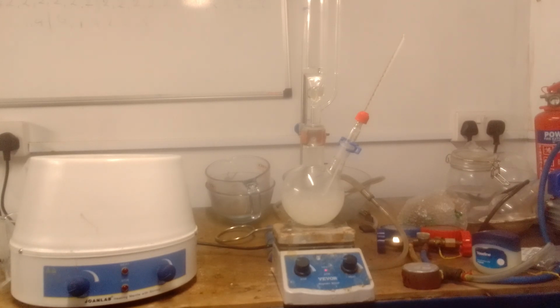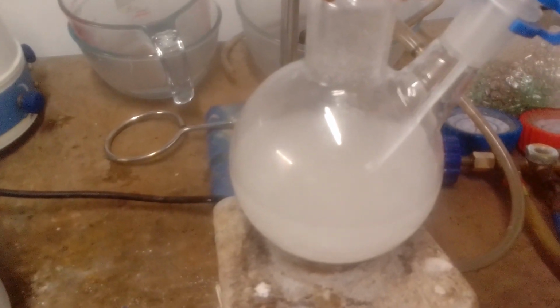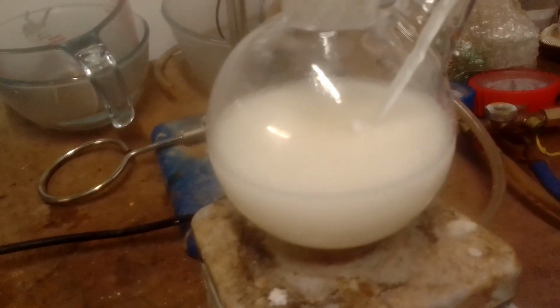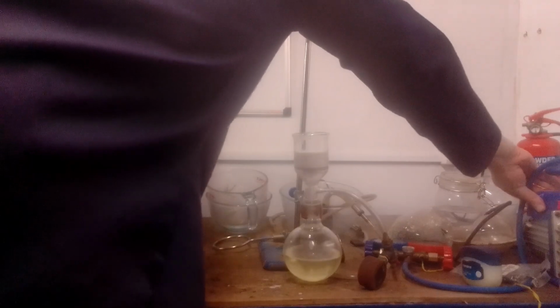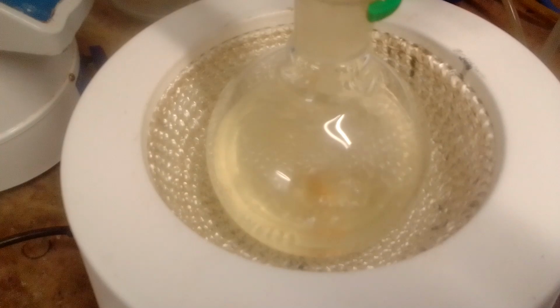A key detail the paper doesn't mention is that the reaction is quite exothermic, which is why I added the thermometer. The mixture started at around 20 degrees, peaked at about 30, and after the addition was complete it was left to stir for 3 hours. It was then filtered by vacuum in short bursts. Continuous running would have resulted in a lot of solvent boiling off. The filtrate was then concentrated by distillation of the solvent.